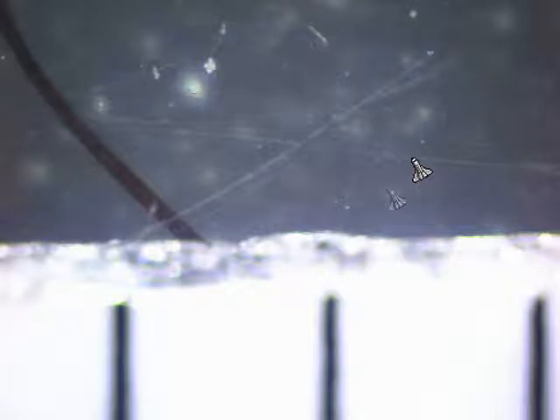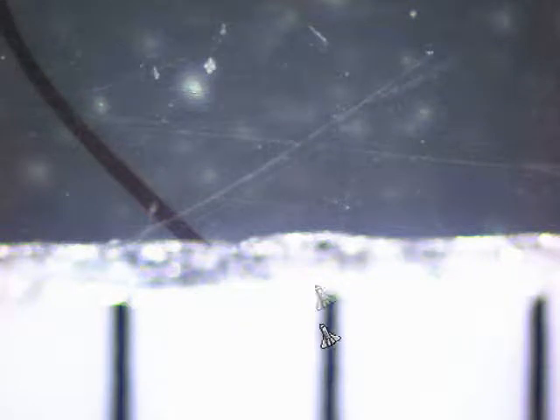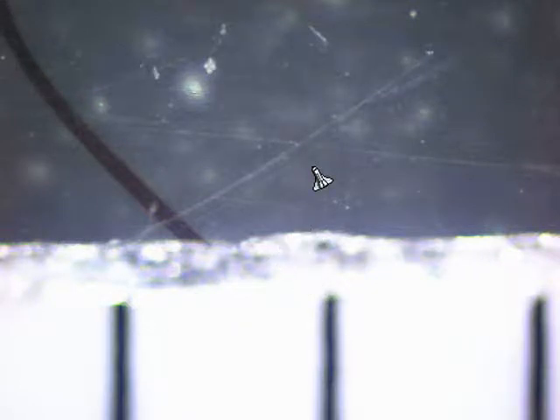Still on sixty times — the ruler is quite out of focus but you can still see one millimeter. Again, about ten hairs giving an average of about 0.1 millimeters. And this is the highest power: 200 times. I've magnified my hair. There's an air bubble there. Not a bad little picture.